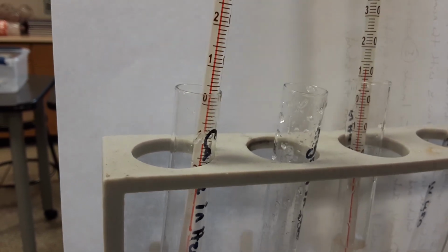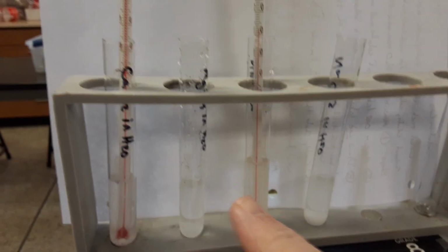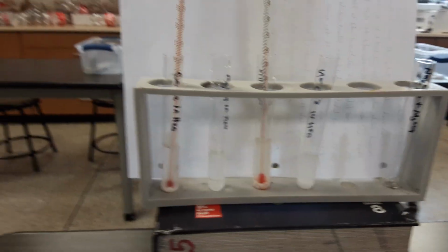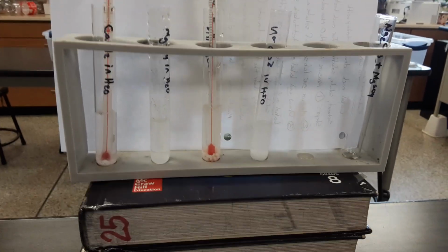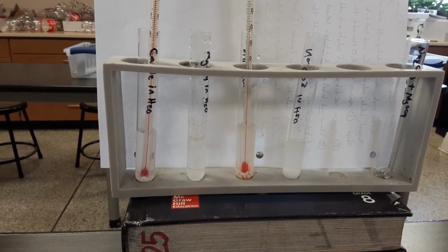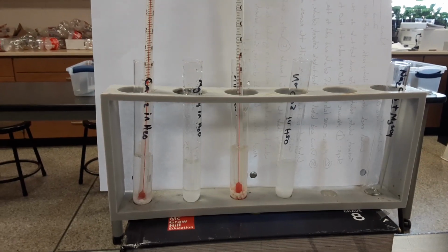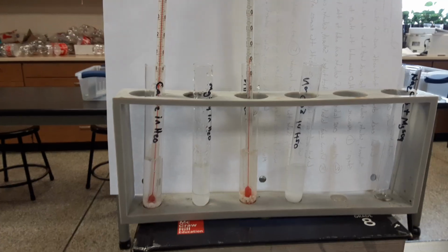This is easier to see in person. Okay, so we've gotten cooler on one and warmer on the other one. Now, this was deliberately chosen ahead of time because we're talking about the difference between causing a mixture versus perhaps a chemical reaction. One good clue that a chemical reaction happens is a change in the energy level.